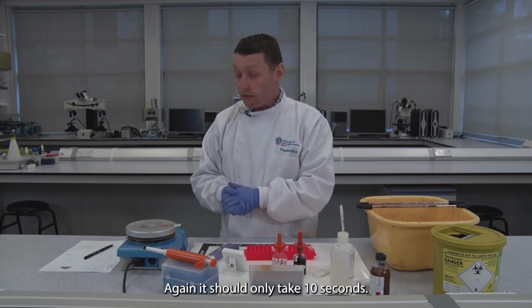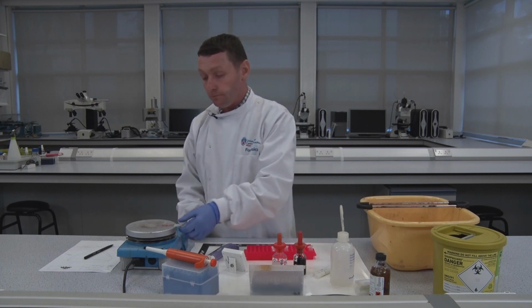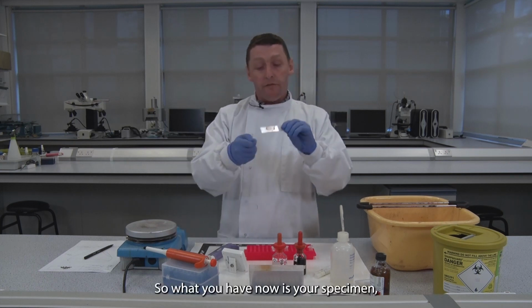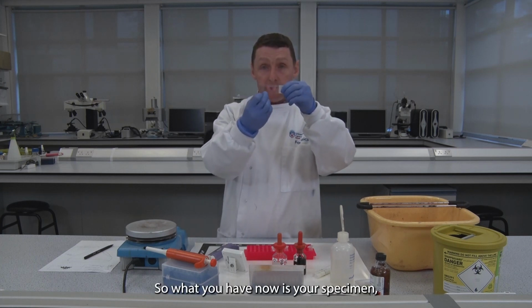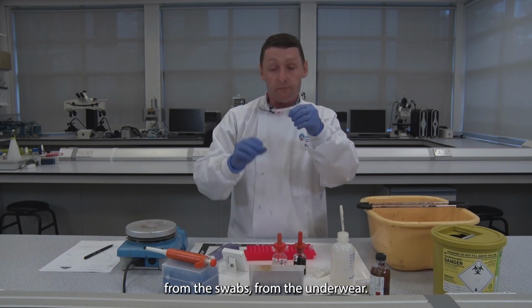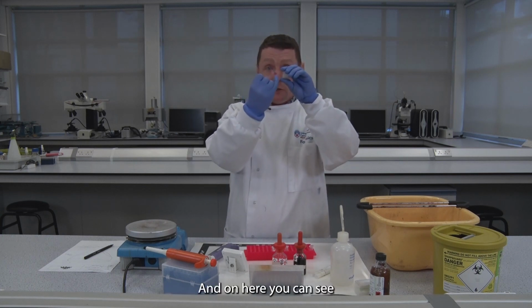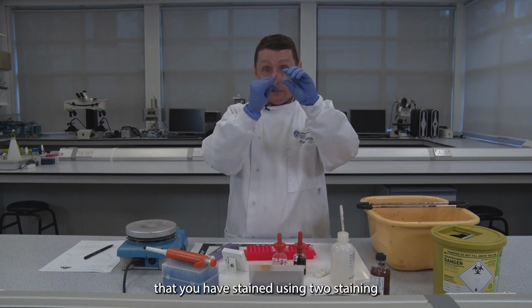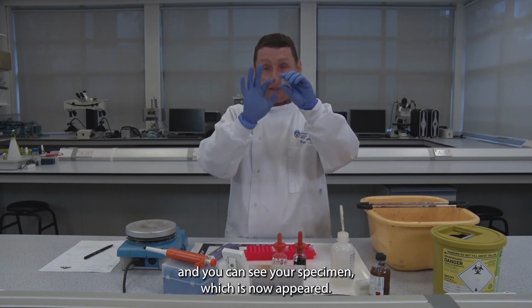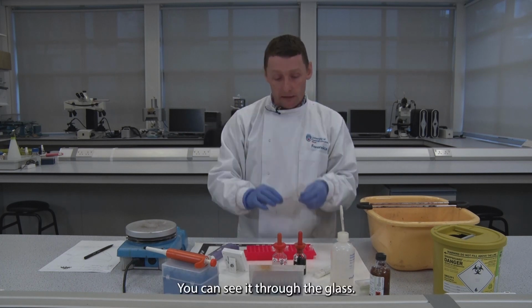Again, should only take 10 seconds. Brilliant. So what you have now is your specimen, which is 30 microlitres from your sample, from the swabs, from the underwear. And on here you can see that you have stained using 2 stainings, and you can see your specimen, which has now appeared. You can see it through the glass.